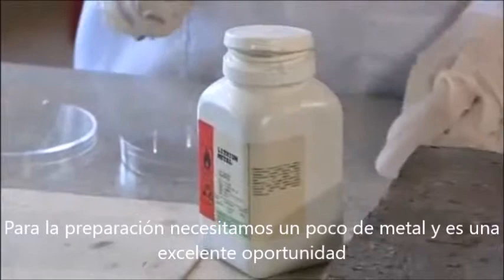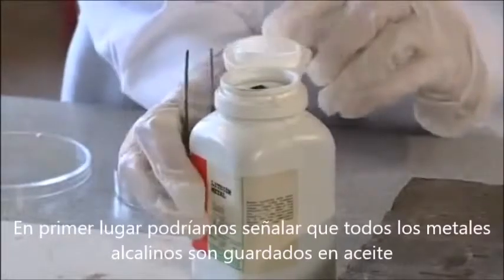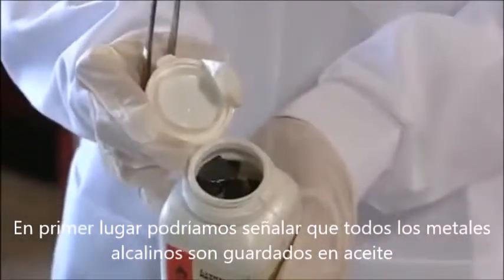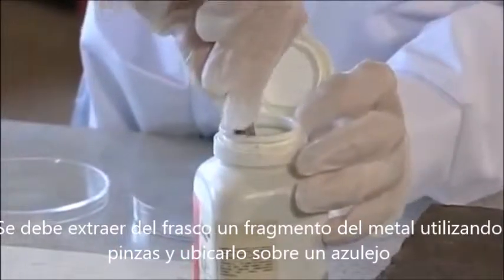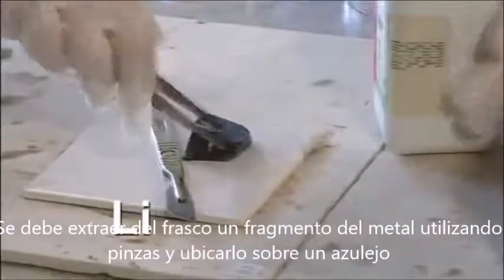In preparation, we need to cut some of the metal, and this is an ideal opportunity to show some of the physical properties. First of all, you should point out that all the alkali metals that we're using are stored in oil. Take some of the metal out of the container using some tweezers and place on a tile.